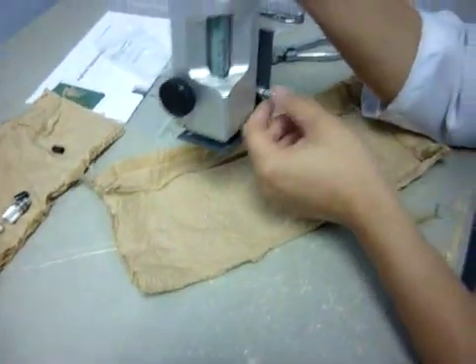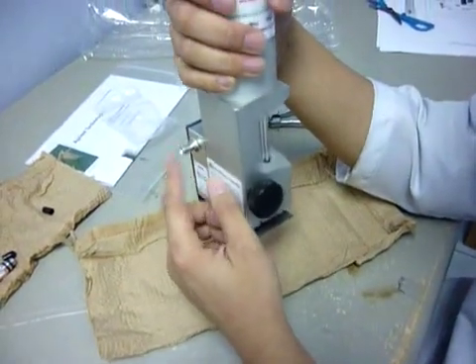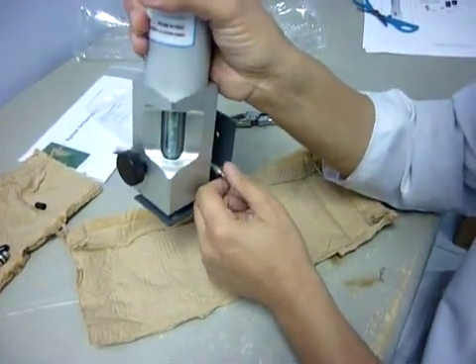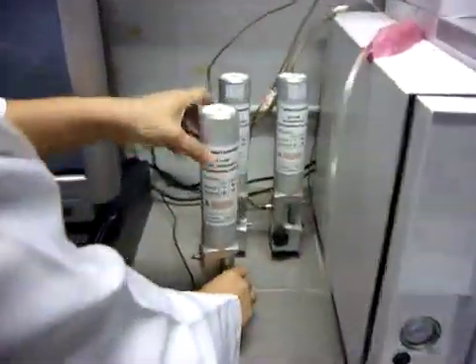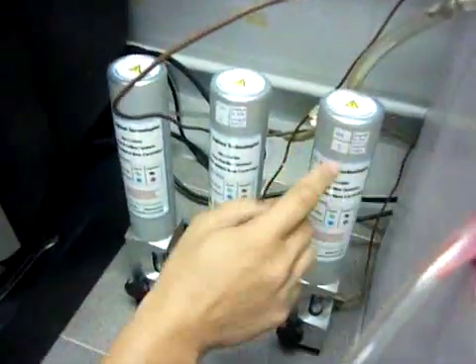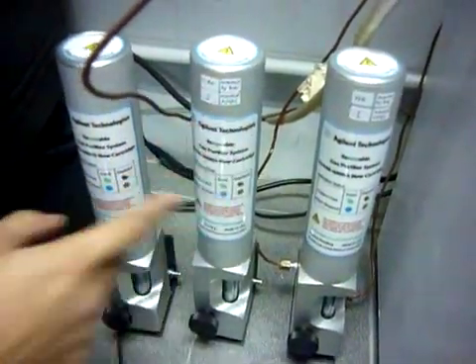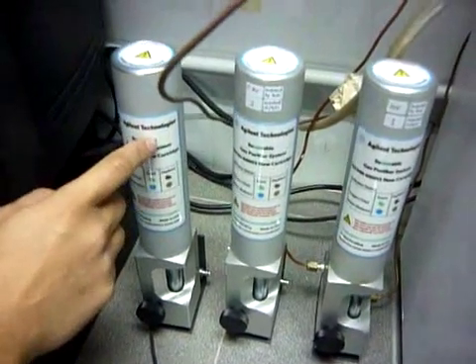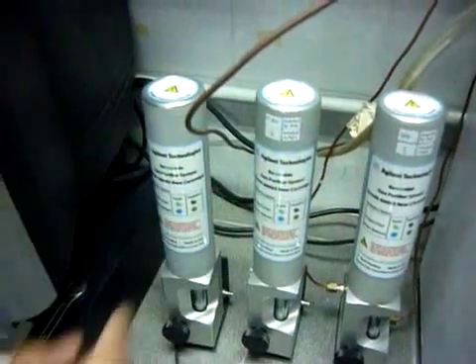The outlet from this one will go — the inlet is from the upstream, from the gas tank. And this is the outlet, which is the downstream towards or into the GC. As you can see here, I already have installed a helium gas purifier for helium, and one for compressed air. This one is now meant for hydrogen, so I will later connect it to the fittings and also to the GC.